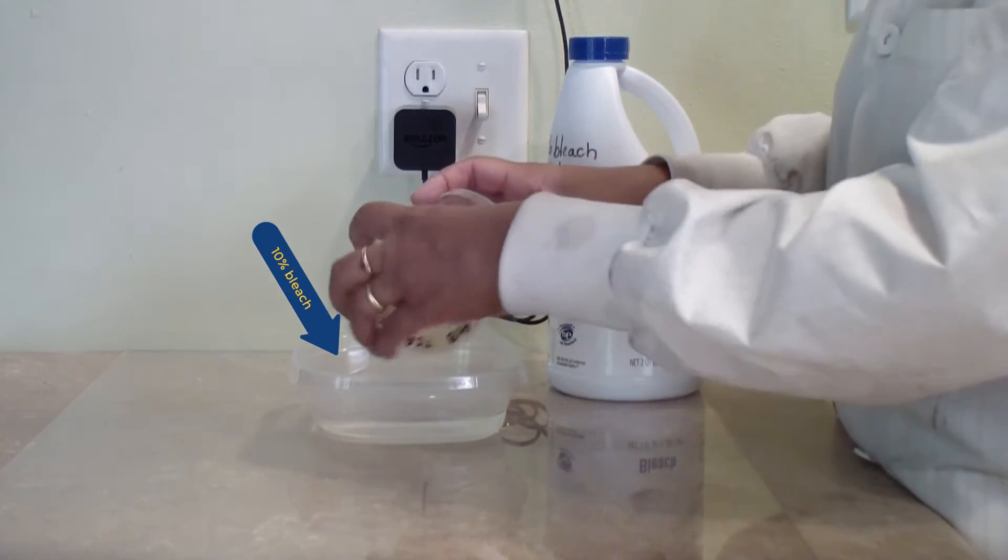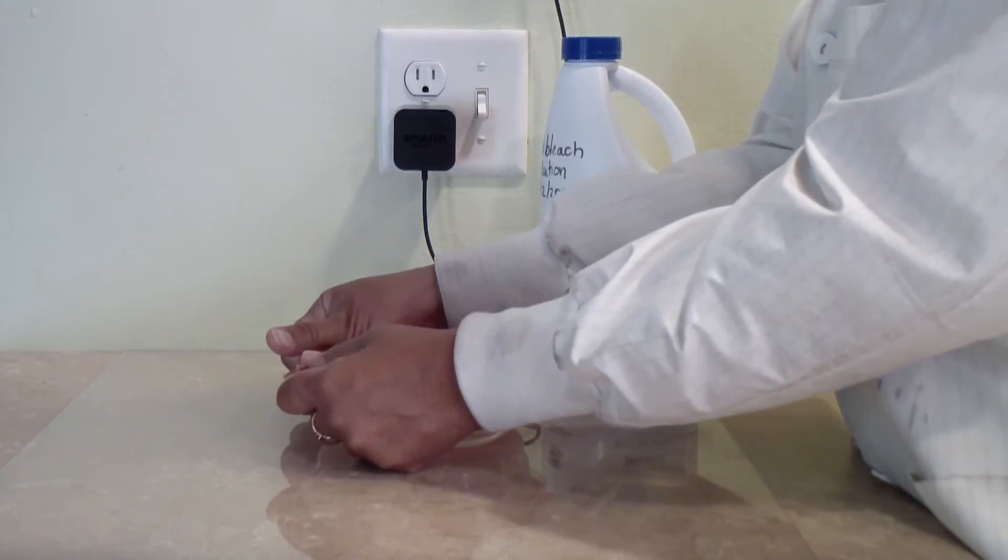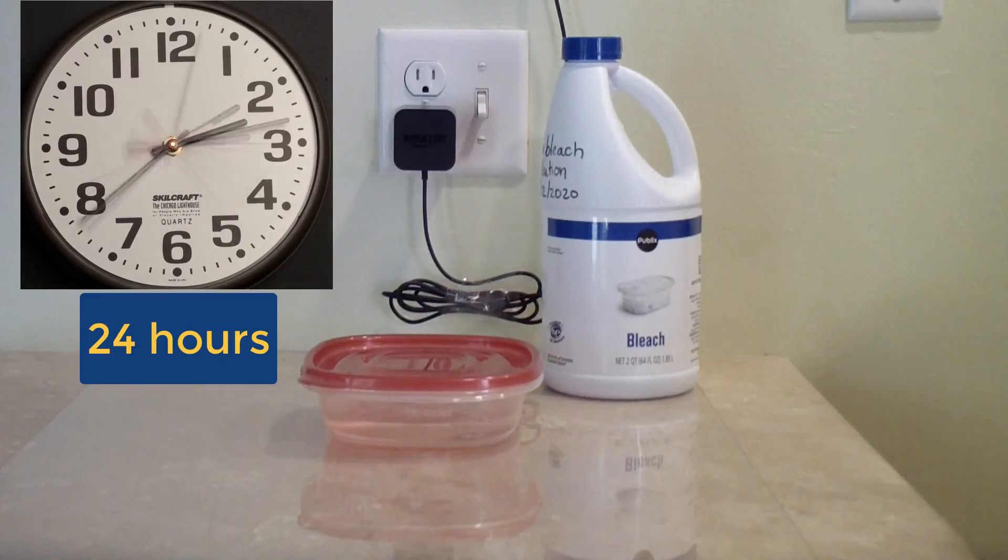Once you are done, decontaminate your plate and discard it as demonstrated in the plate handling video.